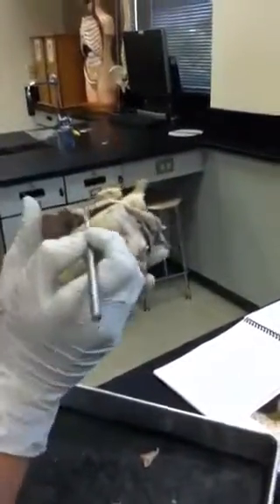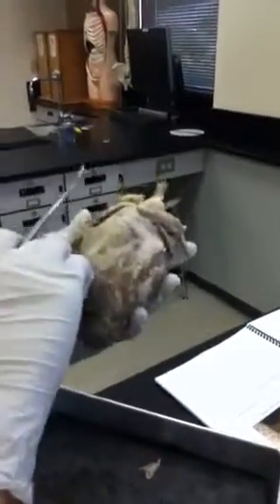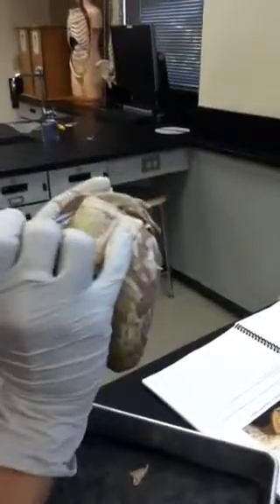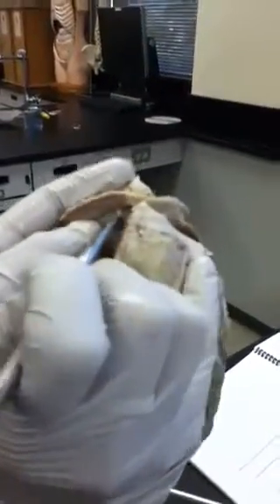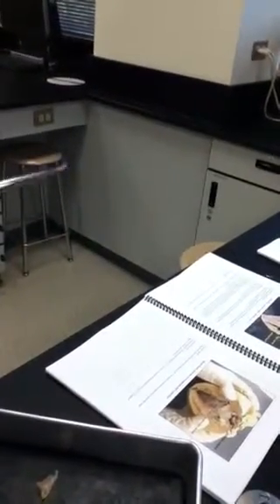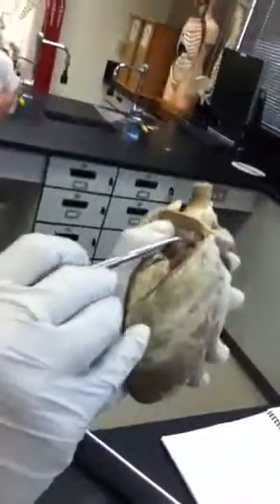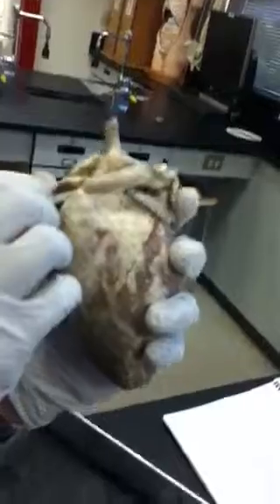All right. So our blood pumps from the right atrium to the right ventricle, and from the right ventricle out to the lungs through the pulmonary semilunars right here. That's where they are. There are 3 of them, but it's kind of cut. So you have 1 right here. The semilunars have 3 cusps: 1 here, 2, and then 3 on this side. Can you see that? 1, 2, 3? They go through the semilunar pulmonary valve, out the pulmonary trunk.